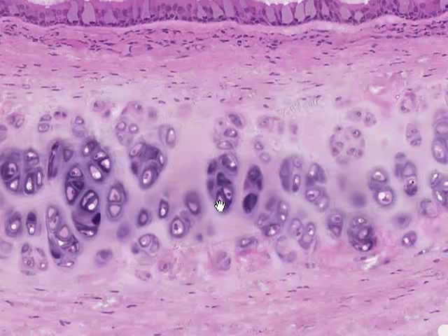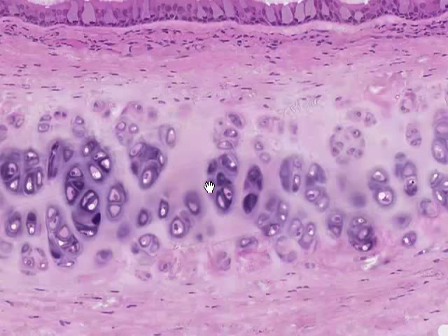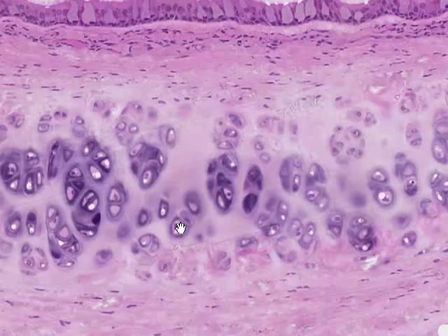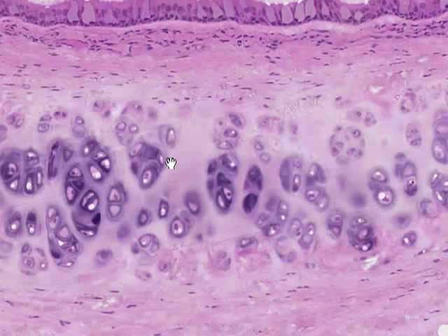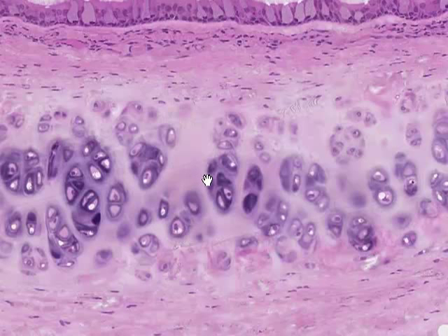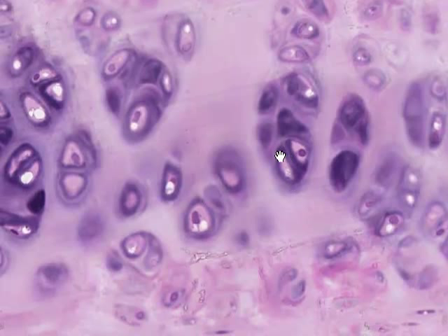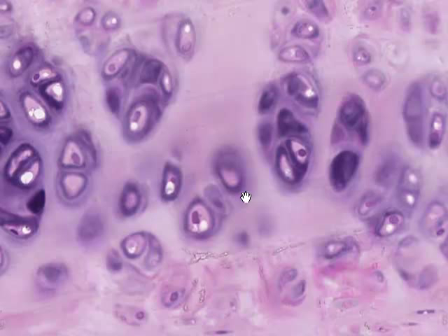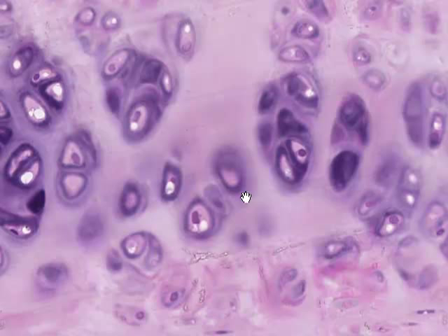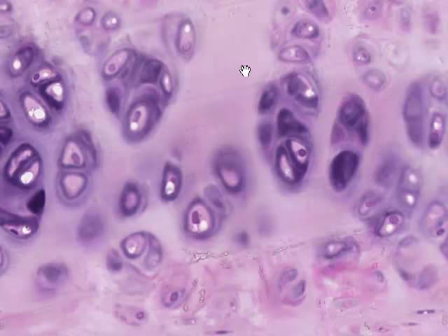These groups of cells are trapped in small openings called lacunae. During tissue preparation the cells often shrink back, so what we're seeing here is a single lacuna — the remains of the nucleus of a cell — and the space around it is where the cell has shrunken back. The area immediately surrounding each lacuna stains a little bit darker than the surrounding cartilage matrix, and this is referred to as the territorial matrix of the chondrocytes. Really, all it is is type 2 collagen fibers that have yet to become compressed and organized into their mature form.